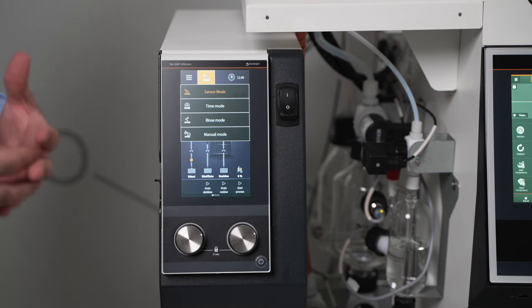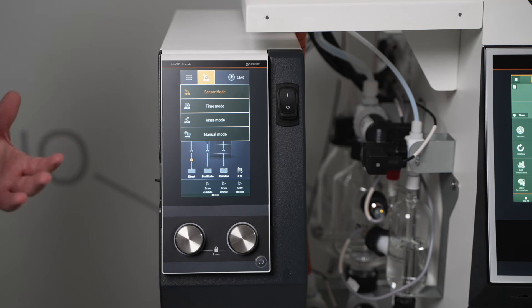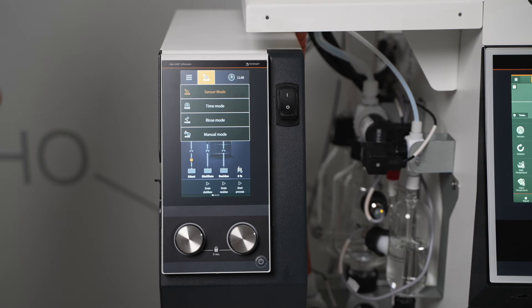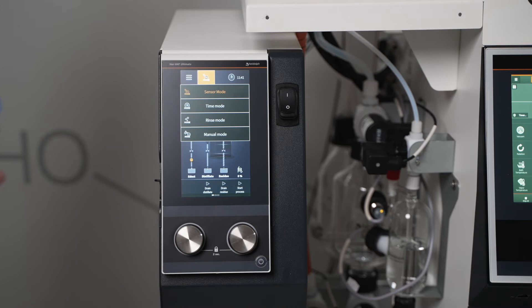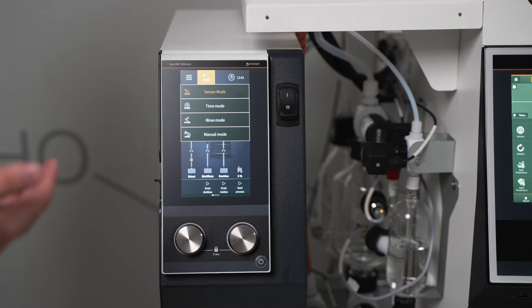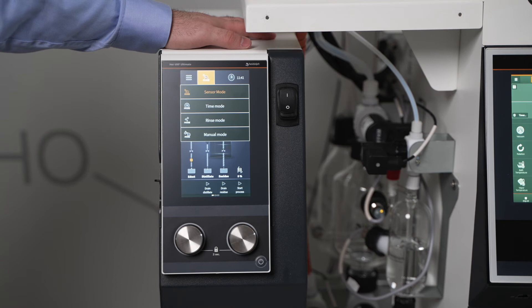That cleaning mode runs a solvent-only cycle, preferably with something that's good at cleaning like ethanol, and basically clears out all of the lines — the condensate line, the fill line, and the residue line. Since there are no pumps, this is a very simple process to do and you will not have to do any manual cleaning anymore. Manual mode would be used if you are working with leftover products that are powder or solvents — that basically cuts out the residue removal process and lets you manually empty out that evaporation flask.